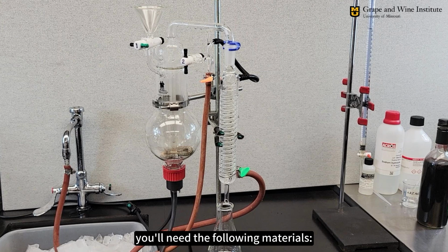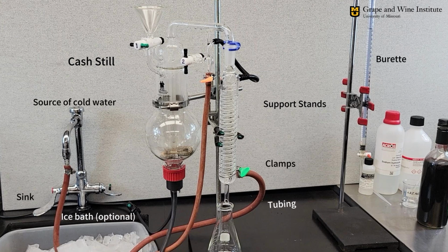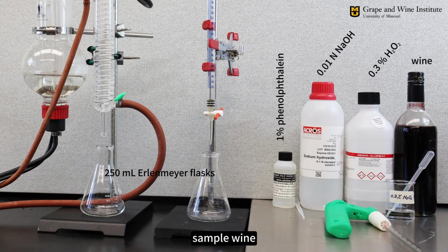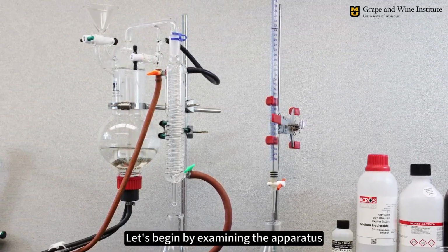To perform this analysis, you'll need the following materials: a steam distillation unit, Cash still, 2 support stands, several clamps, tubing, source of cold water and a sink, an optional ice bath, a burette, 250 ml Erlenmeyer flasks, 0.3% hydrogen peroxide, 0.01 N sodium hydroxide, phenolphthalein indicator, sample wine, 10 ml pipette and dropper and pre-boiled distilled water. Let's begin by examining the apparatus.